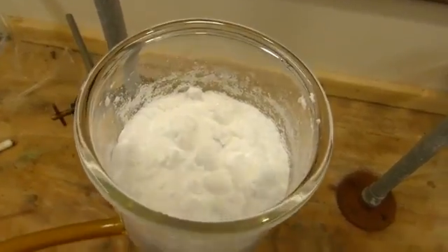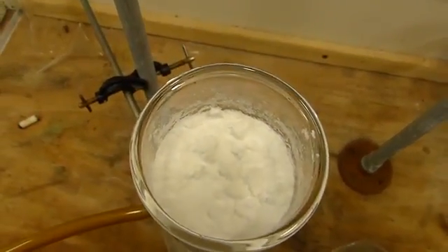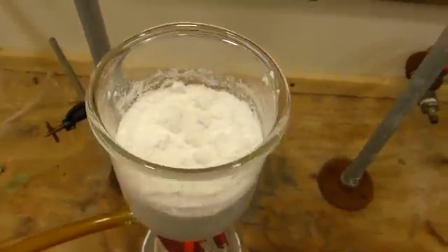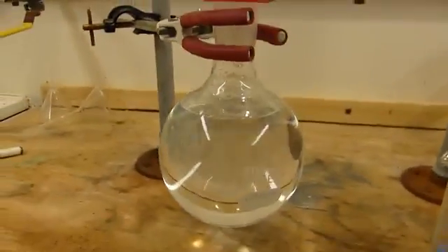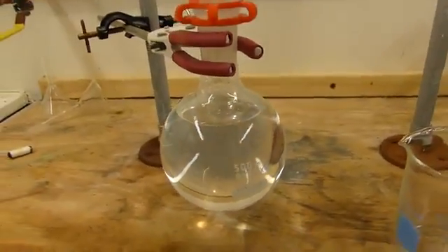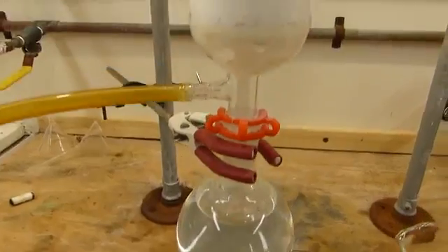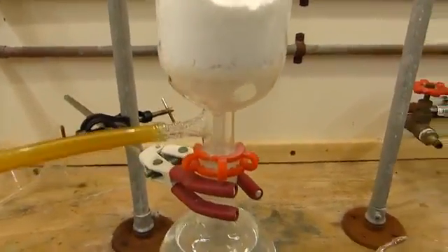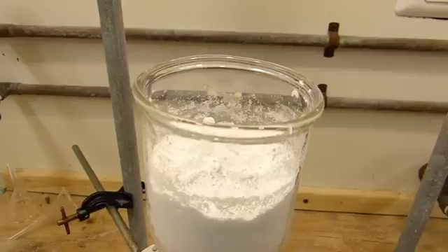And you can see that the flask is now full of a powdery white solid, which is the benzoic acid. And the flask got pretty full, but not overflowing, which is good. I'll just leave this on the vacuum for a little bit to suck the last of the water out of it. And then go ahead and dry that.